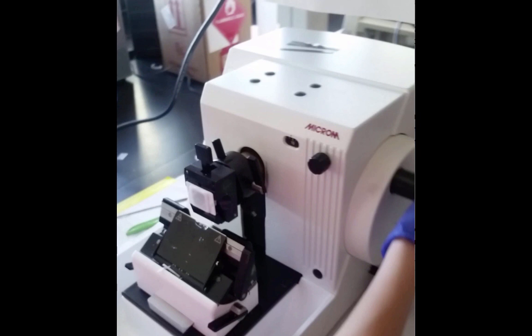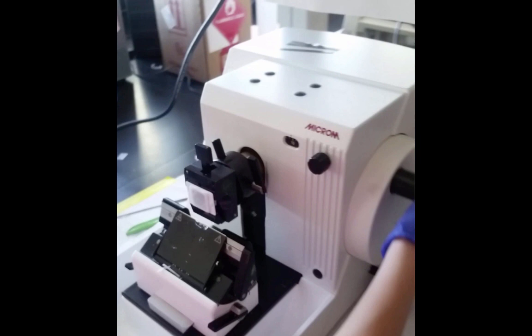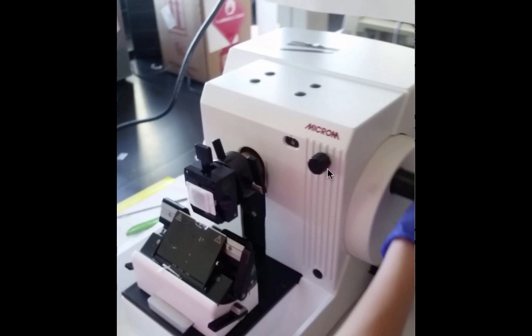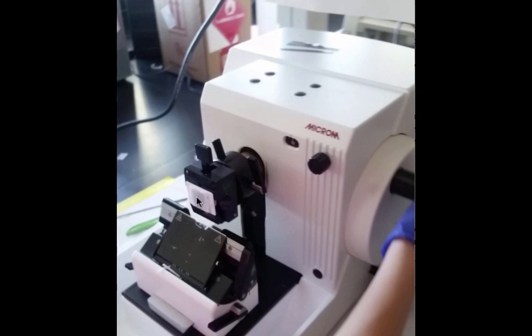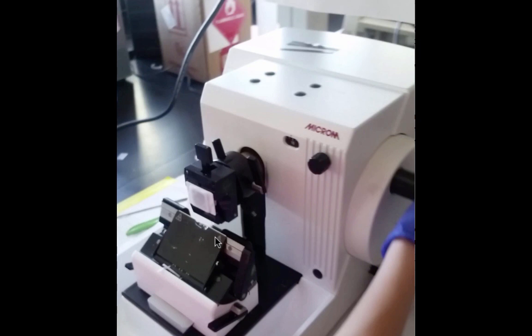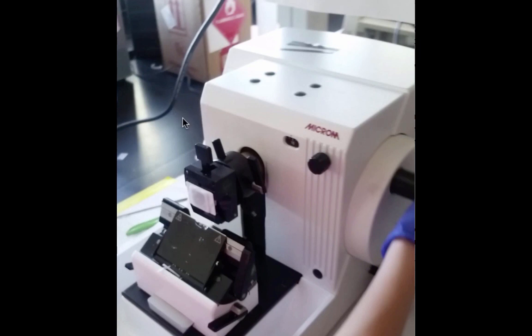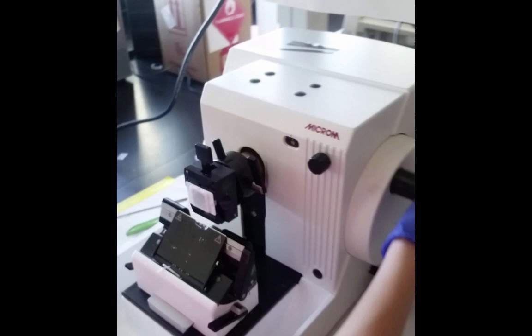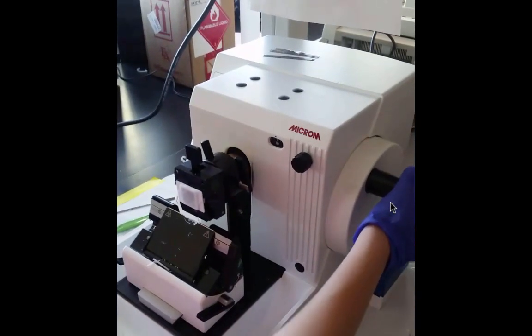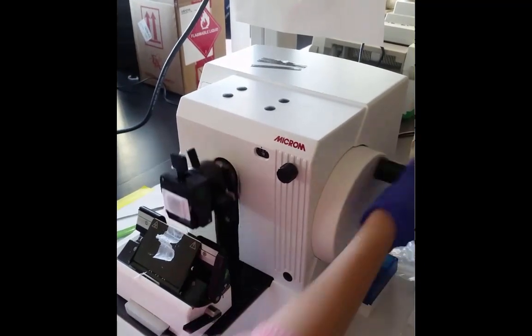When you use the microtome, it is the piece of equipment shown in the picture. The first step is to adjust the thickness of the sections — you'll set it to 10 microns using the knob on the top right. The second step is to adjust the position of the block face so it is just right at the knife's edge, using a handle on the left side of the microtome. When you have it in the right position, smooth quick downstrokes of the handle on the right will produce a ribbon of paraffin wax containing thin sections of tissue.